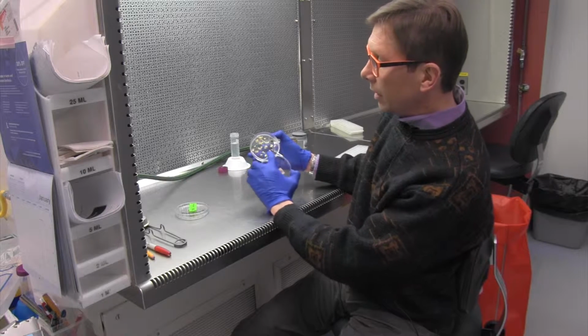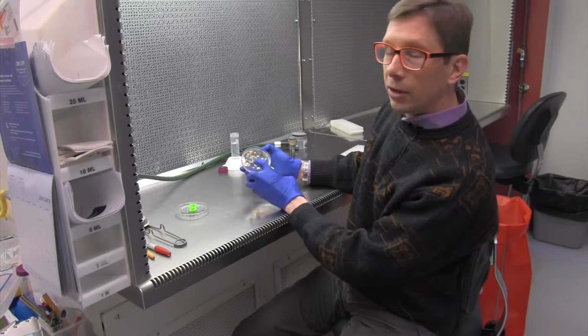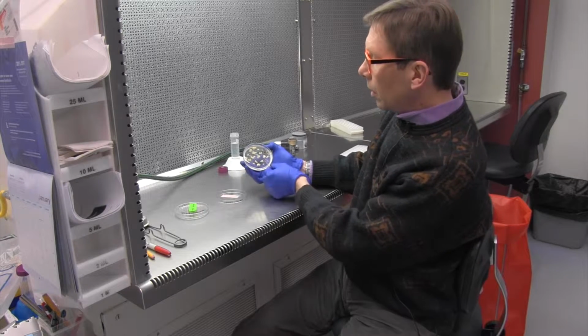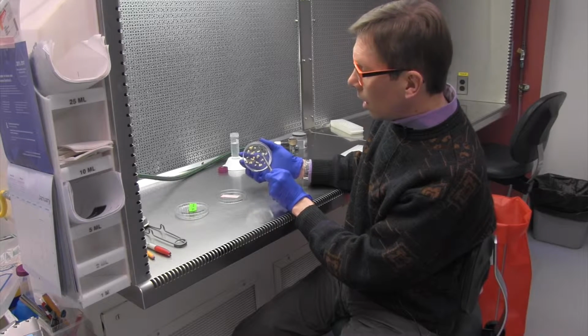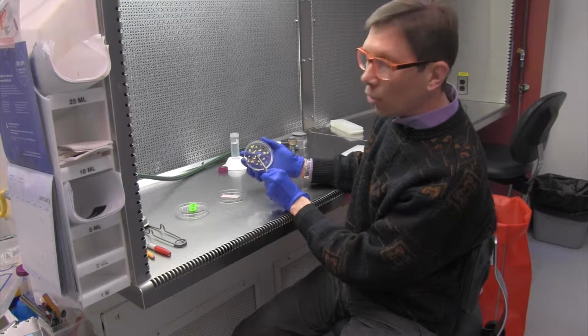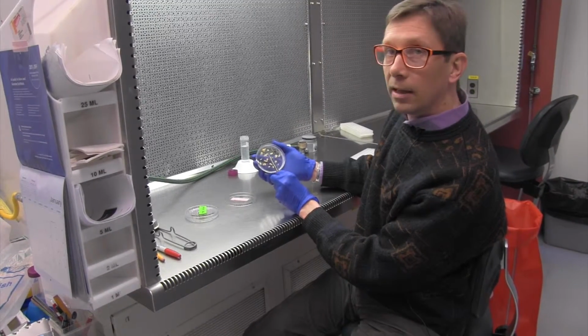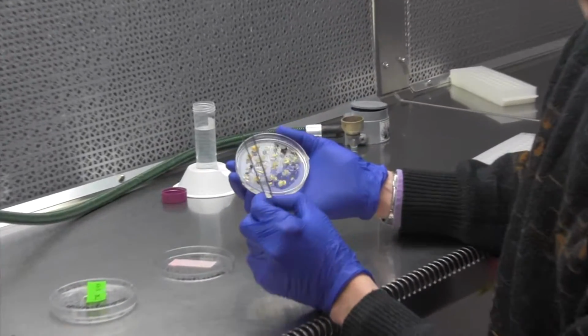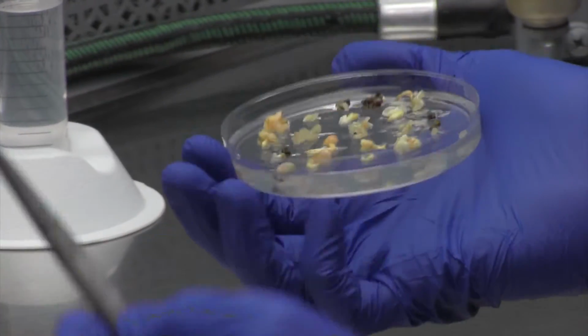They'll get a little bit bigger in these. These are a little bit in the early stages, and they'll start to develop on this long axis a primary root structure. And when you see that, it means you can transfer it to a different type of medium that begins to grow the plant as we're used to seeing it with the leaves and stuff.